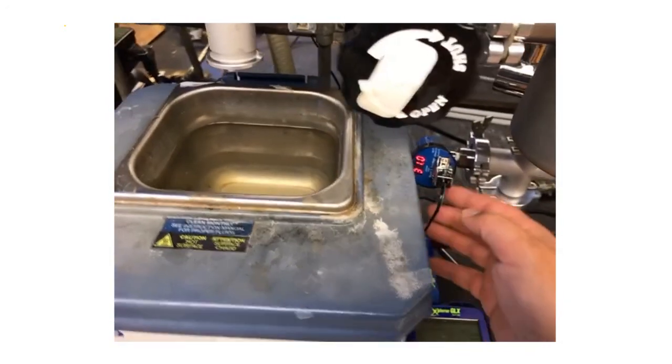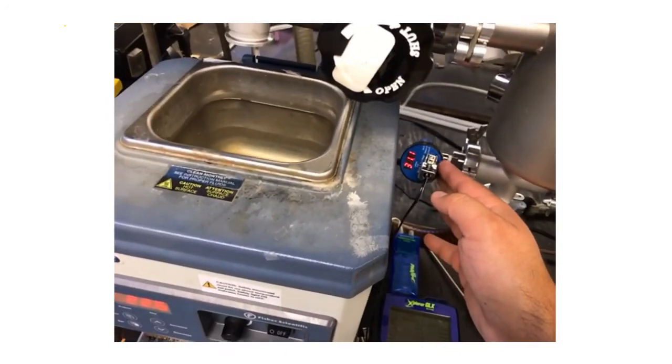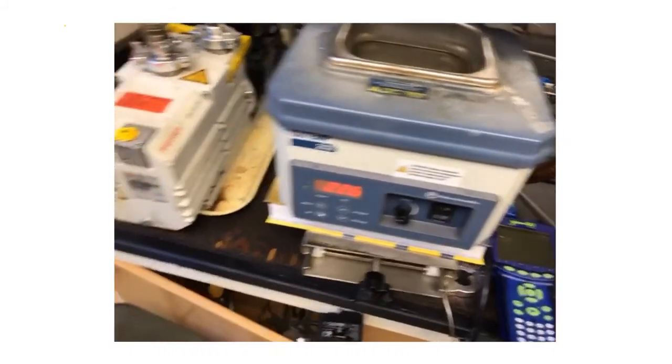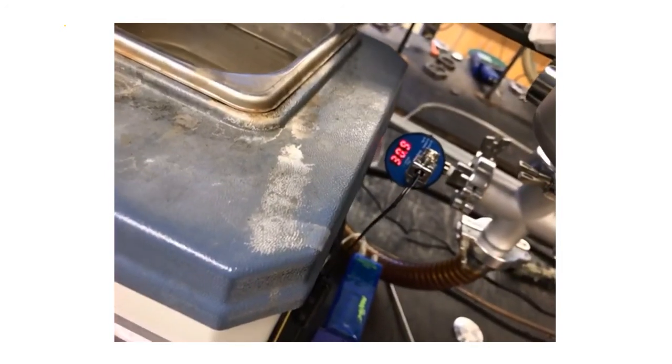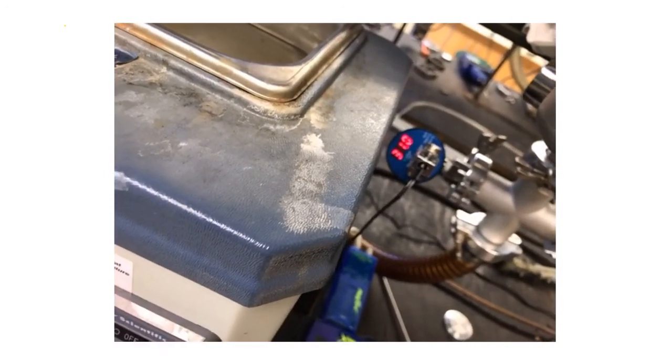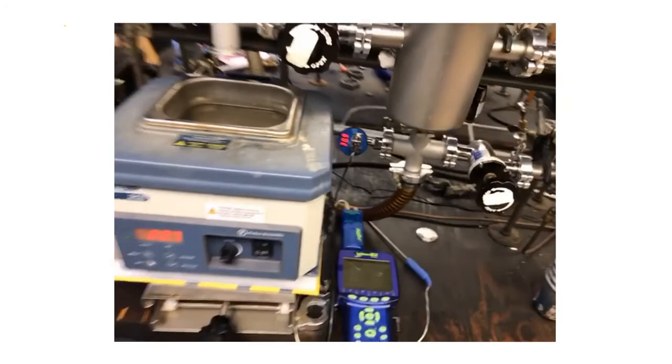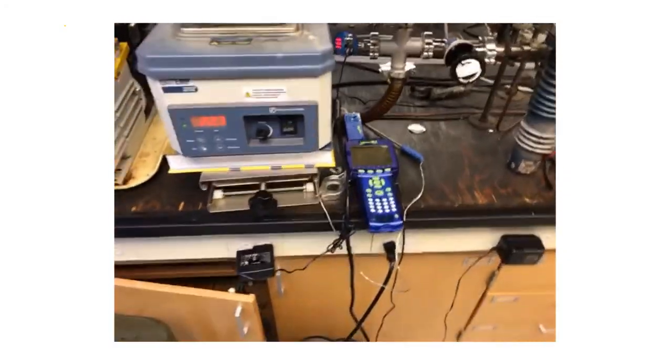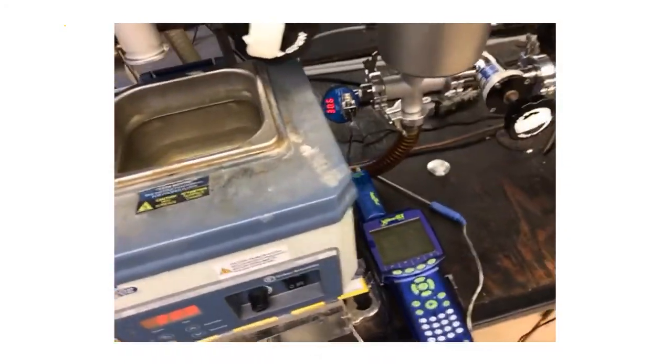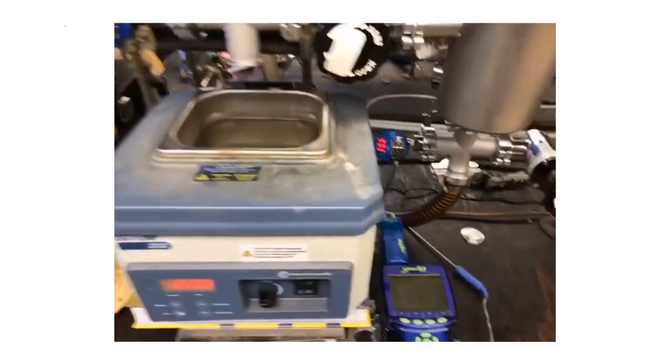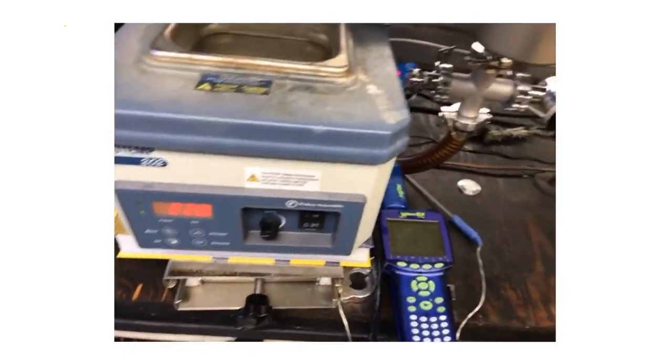To mention a couple of our gauges, I have a vacuum gauge right here—nice digital vacuum gauge. This is reading the pressure in the exhaust line of our pump. I don't know if you can see it—it's kind of hard to read back in there—but it's reading about 31 millitorr right now. 31 millitorr is a pretty low pressure that's being kept by this vacuum pump here.